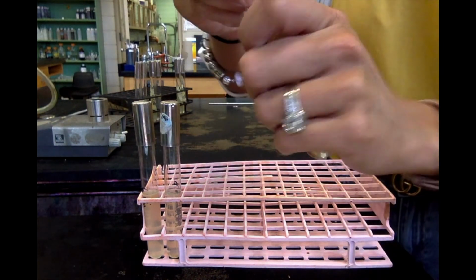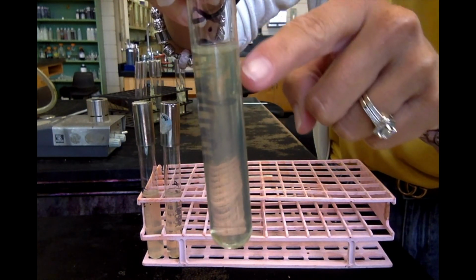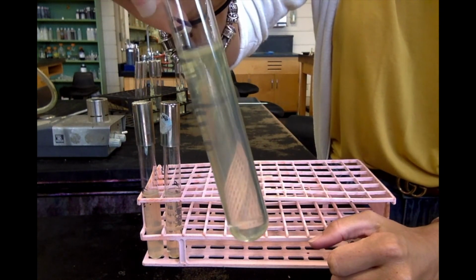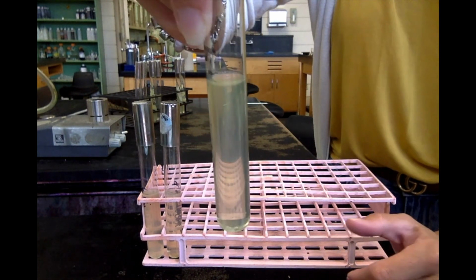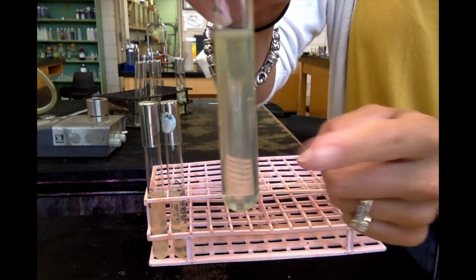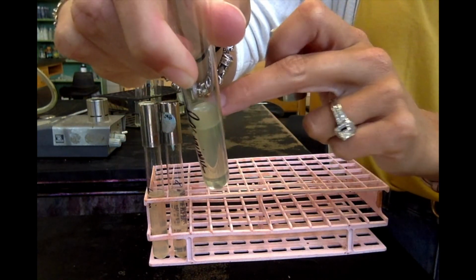The last one that we have is Pseudomonas. So, you see that there's growth concentrated just around the top, but there is no growth at the bottom. The bottom is completely clear. There's nothing there. Okay? But there is growth all along the top of the tube. So, Pseudomonas is an aerobic motile organism. Okay? So, it has to have air. There's no growth down here. And it is motile. So, it moved away from the stab line. And you can see that by looking down, and you'll see that there's growth all along the top.